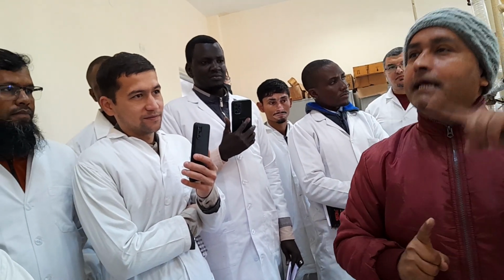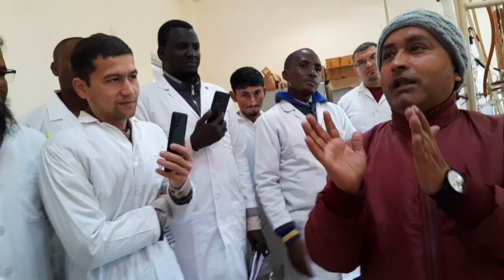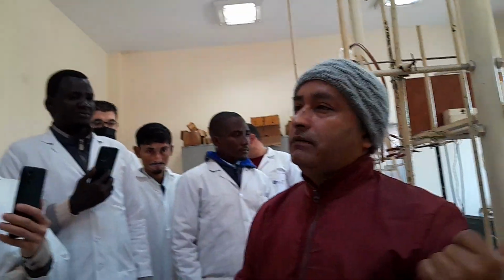First you will be caught at density, because you have a naphtha cut from C5 to 140 degrees centigrade. Before sending the report to the refinery, that naphtha has to be passed through at least 80 to 90 analyses. If any analysis fails, it means your TBP distillation has failed. So first is density. If you have overlapped your product during the flooding, that will disturb your density. Somehow you will manage the density, because you are doing it yourself, so you can pass it. Let it be.